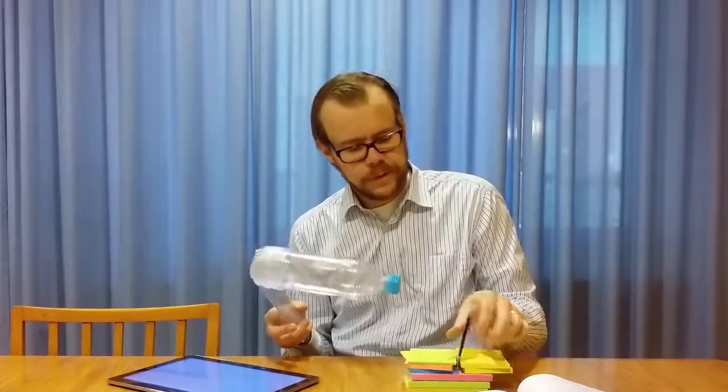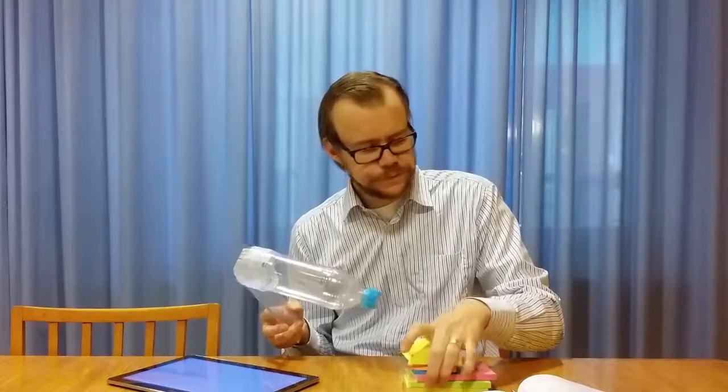There is also this control unit that controls how it operates and how fast it shall follow the contours of the surface. I mean, there is a regulating theory around this, and if that has been misconfigured, then you can get all kinds of artifacts due to that. One thing, for example, is that when you go over like this, it can start to have a vibration noise effect afterwards, and then you create ripples. So you see ripples in images when you go across a sharp edge. And that, of course, doesn't exist in reality. It's something that you created due to wrong configuration.